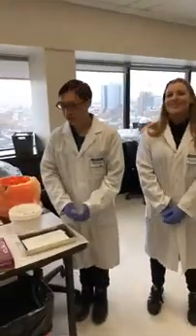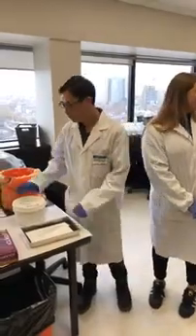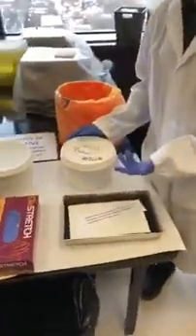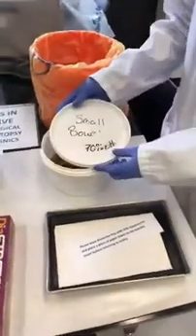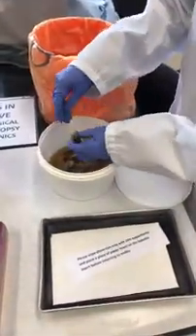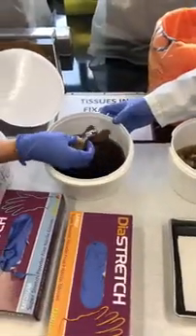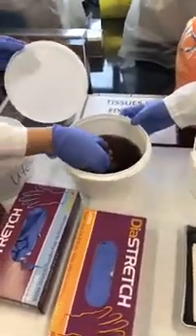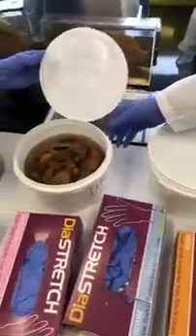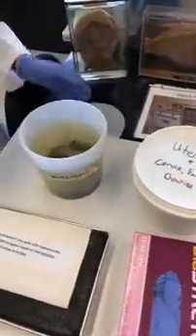Welcome to the histology lab. In this lab, we receive samples from the hospital. Here are some examples of what we get — here is an example of a small bowel, we have the spleen, the uterus, the cervix, and over there you have some bone and muscle.